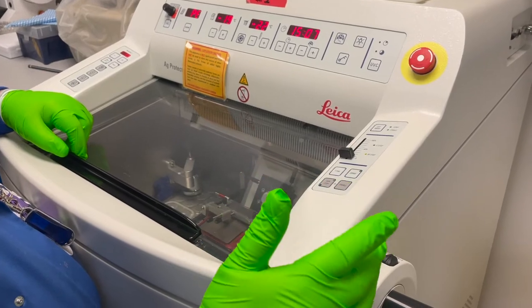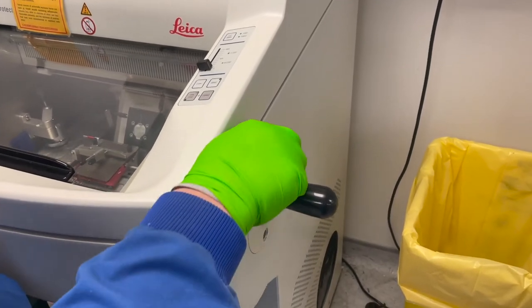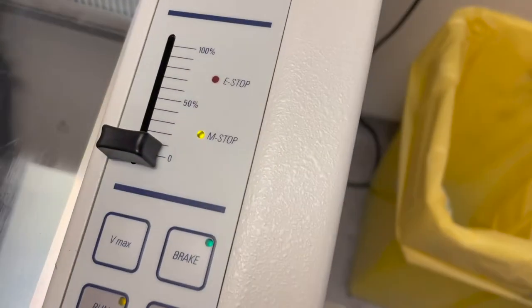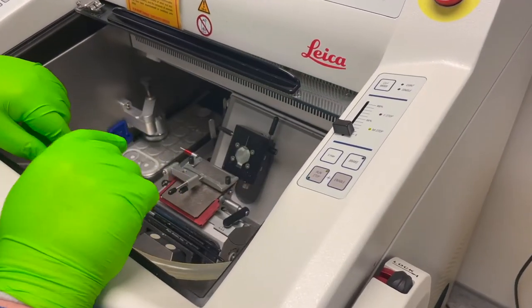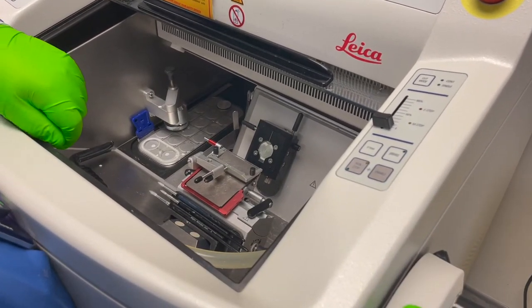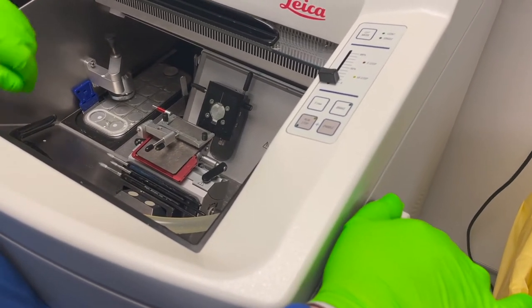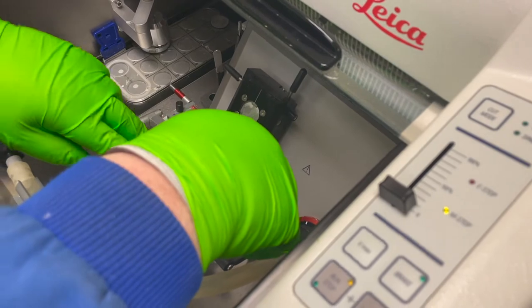I'll start off on the hand wheel. You need to ensure that the hand wheel is locked at the apex. When it's locked at the apex, the hand wheel won't turn and motor stop is illuminated. When the hand wheel is stopped, the head is fixed. If you've got it off lock and over the apex, the head will want to take your fingers towards the blade. So for safety first, always lock the hand wheel. There are additional safety features I'll come back to later.